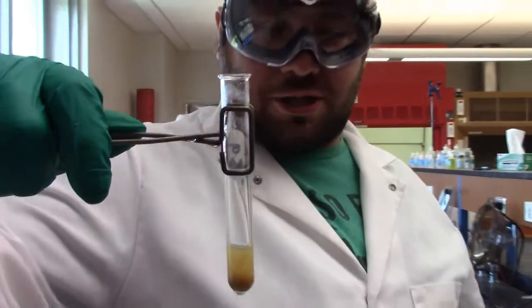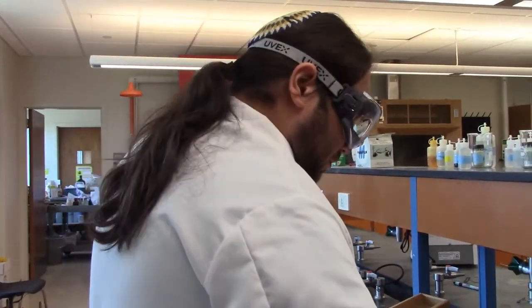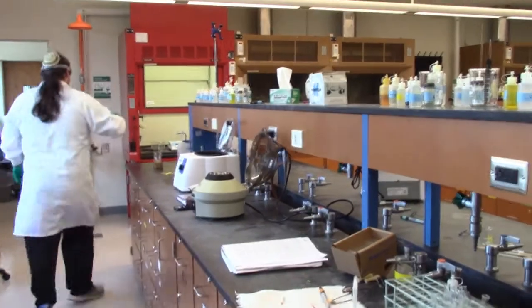It also smells quite badly again, so be glad you're not here. Professor French is complaining a lot about the smell. So we're going to go get rid of that. We're going to put it over here. We don't want it near us.